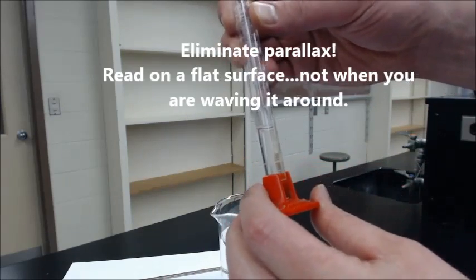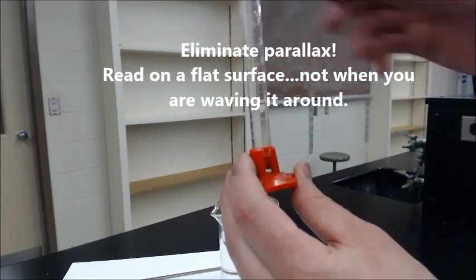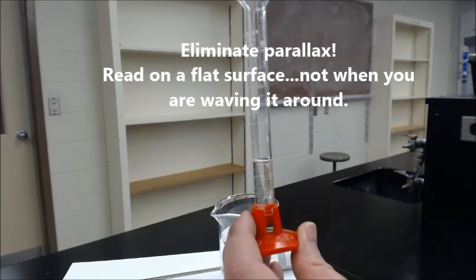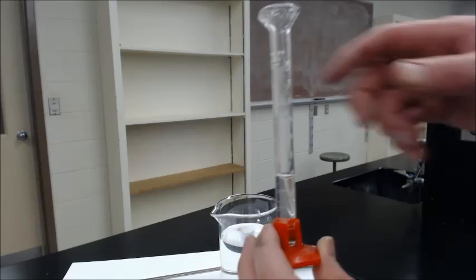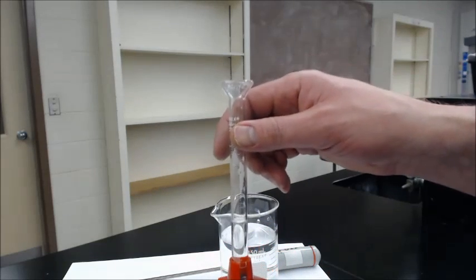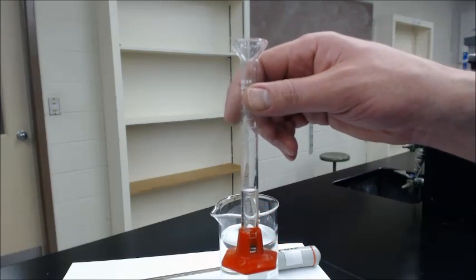And it's roughly 3.8 or 3.9. I'll take a better look when I get some parallax measuring. So we'll measure the volume. Do your calculations from grams to moles, and we'll be able to figure out the concentration of urea.